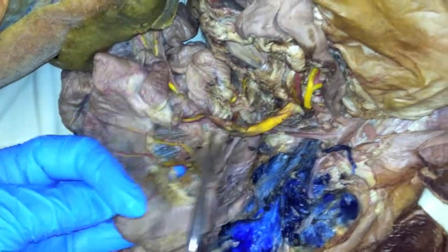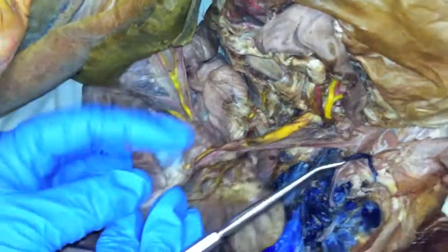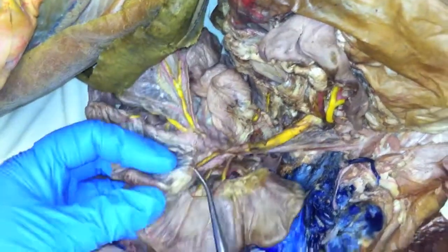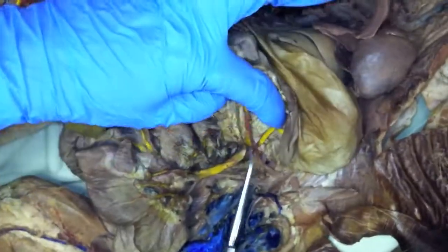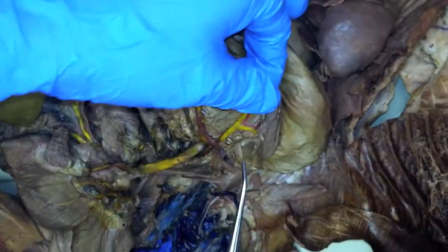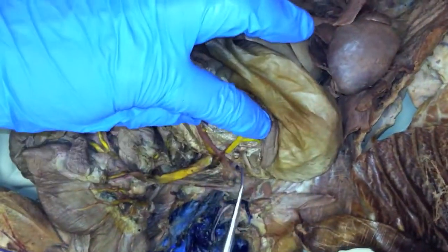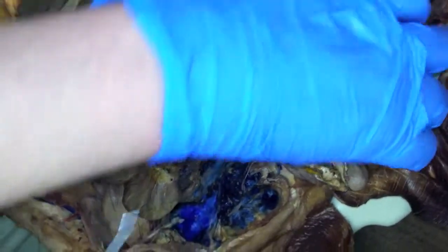So this becomes the caudal mesenteric, exactly. And that's running into the cranial mesenteric. And then the cranial mesenteric receives all these, which are the intestinal. And then it receives this one, which is the ileocolic. And then up here we've got a big one coming across here, and that is the gastrosplenic. And then you can see your splenic artery or veins coming from the spleen to make up part of that, plus some gastrics coming down. And that runs into the cranial mesenteric and then becomes your hepatic portal.